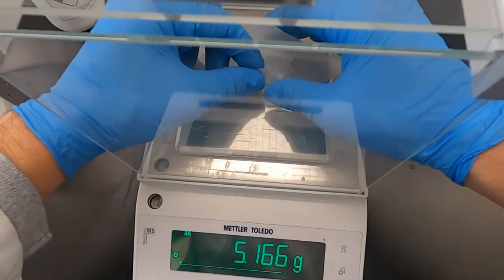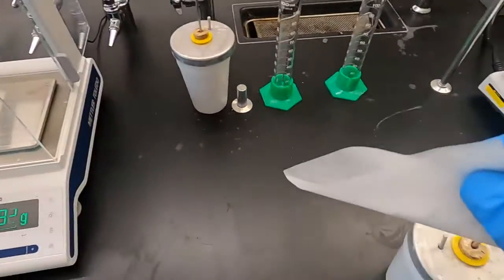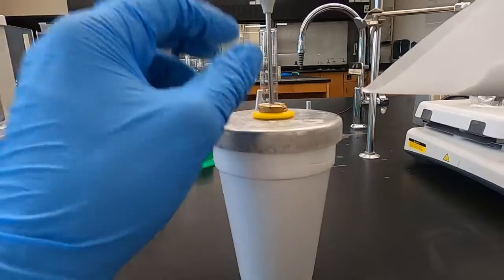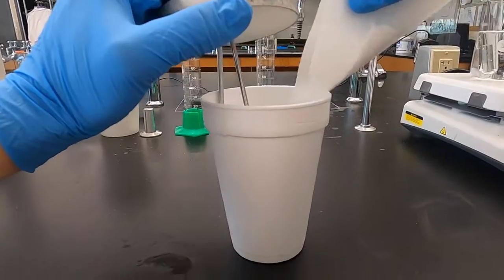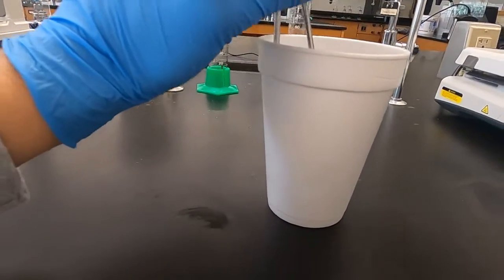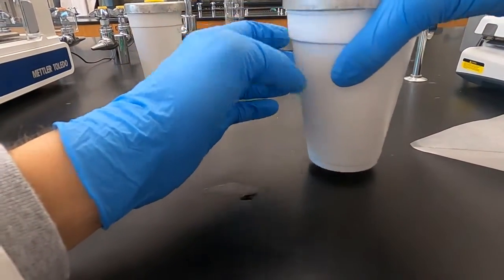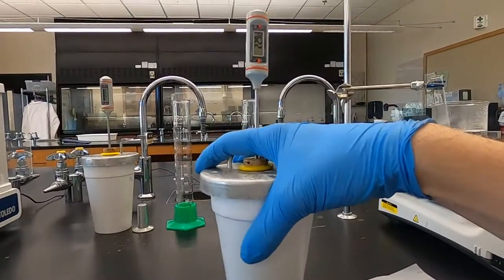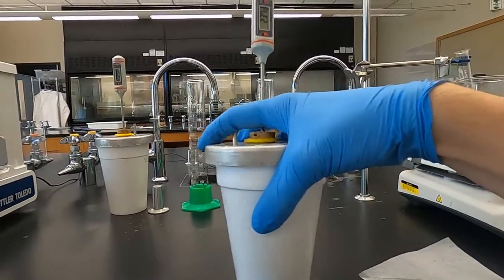So I'm very careful not to drop any of this. Nice part of folding is now I just grab by these corners. A nice area to pull out. So it's at 21.5. Just call it that. And let's go. So we're on the rise, 23.1 so far. Keep swirling.